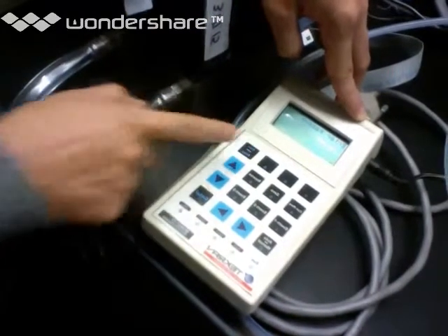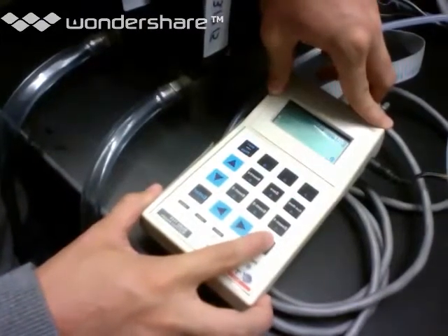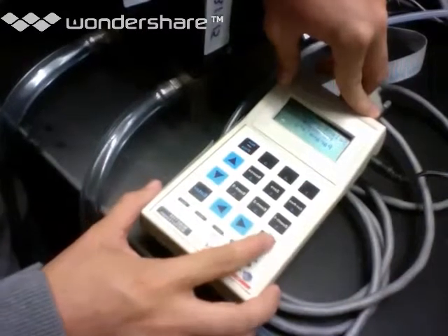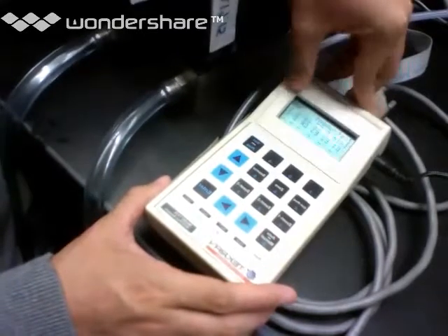Okay, we don't mess with that. That's for maintenance people, if they ever come and handle this. That is pretty much it for this guy. You don't really have to do much. So when you want to get out of this, you just press Run Program again, and it'll go back to the main screen.